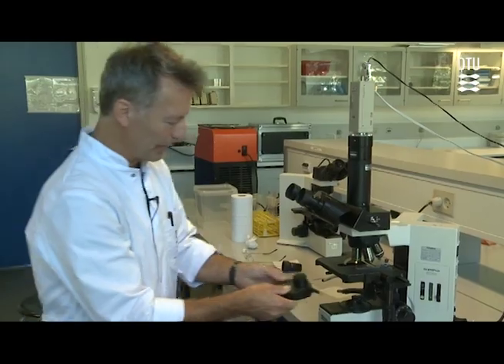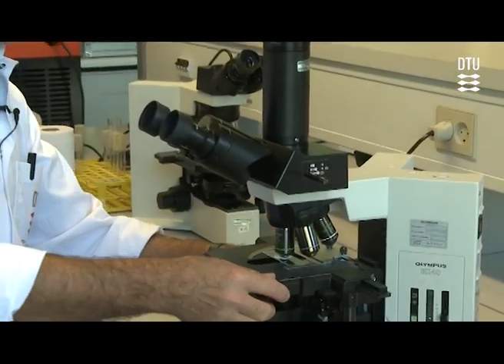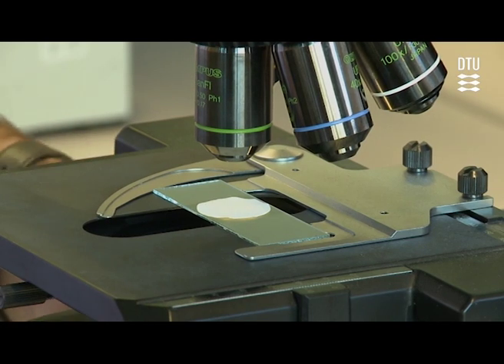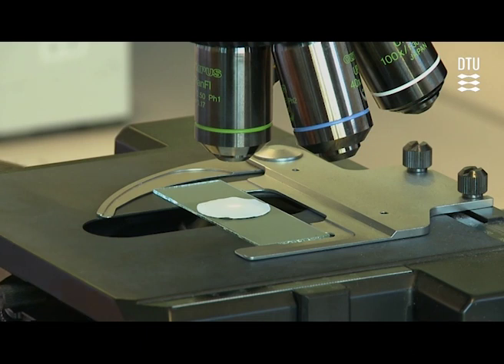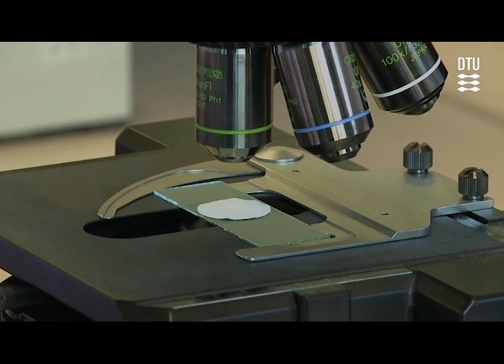So I'll try to show you here with a little gimmick I made. If we take some paper, we can try to see what the condenser does with the light without doing actual microscopy. If we now lower or raise the condenser, you can see the light start focusing, because this cone of light, we can make smaller and smaller. And this is almost like it would be if it's correctly set, and you can see the aperture clearly down in your ocular.